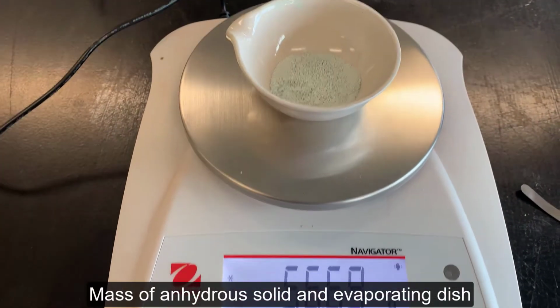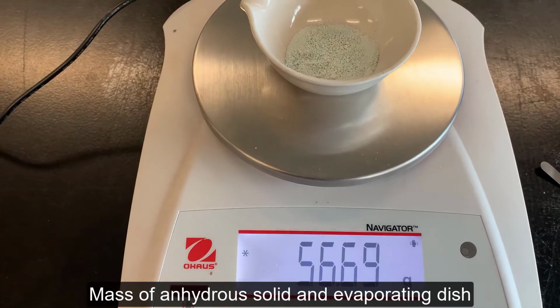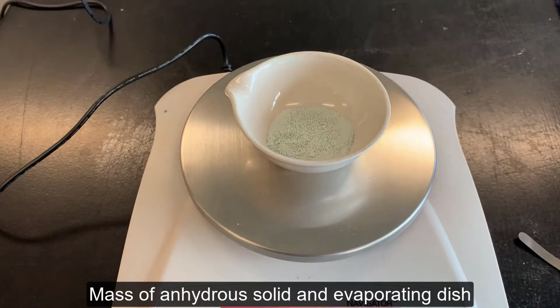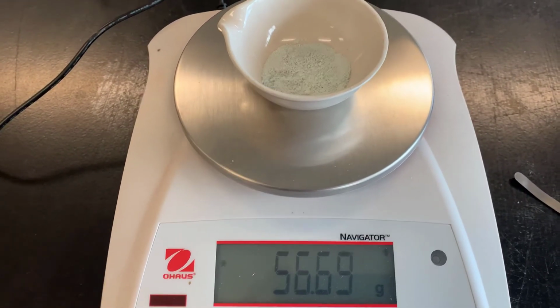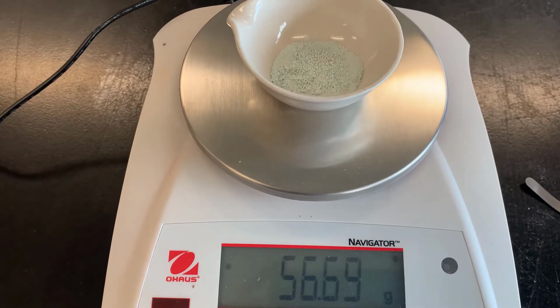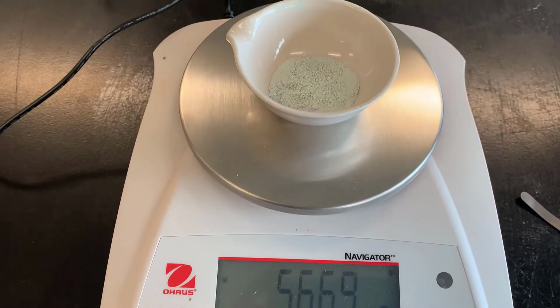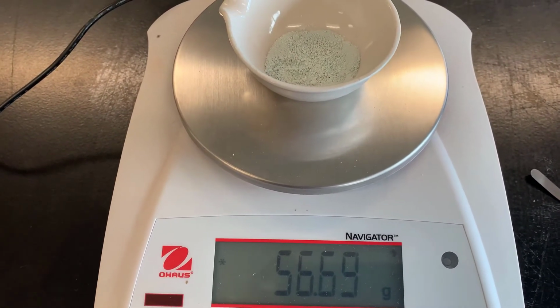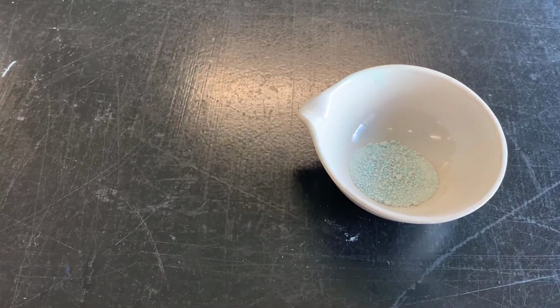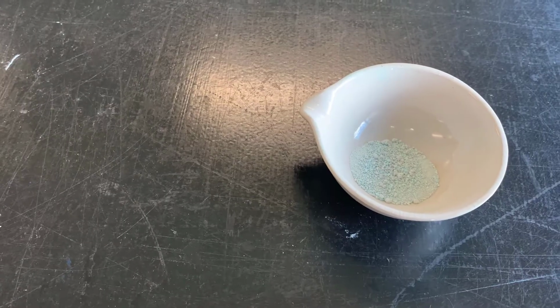Okay, upon heating the sample again, the mass is now 56.69, and that was exactly what it was before. So I'm going to assume that I've driven off most, if not all, of the water. Just to show that you can rehydrate the sample, I'm going to add water back to it. I just want you to notice what occurs.